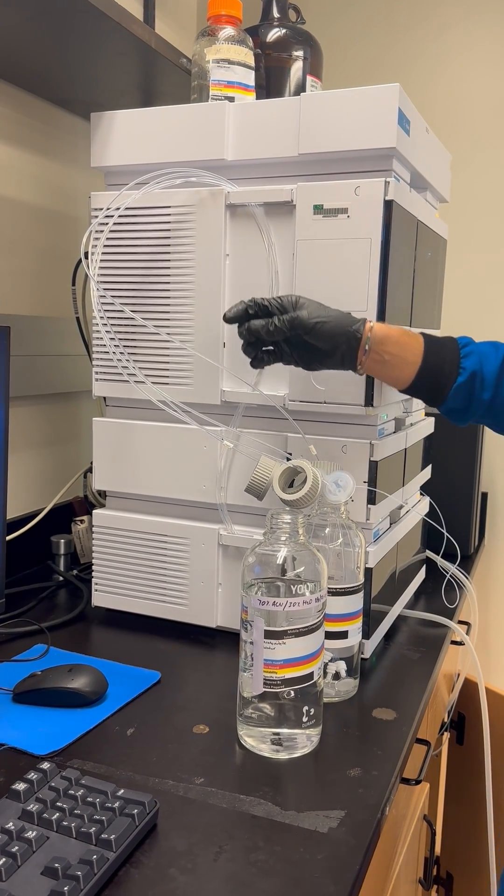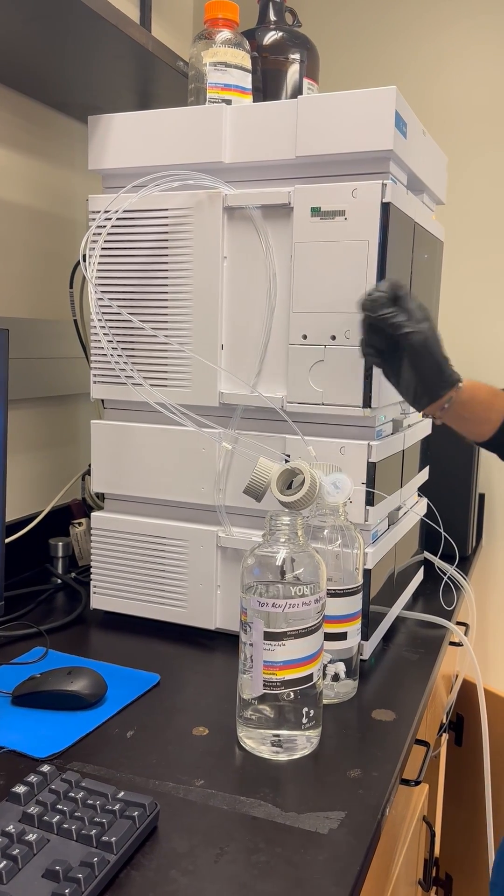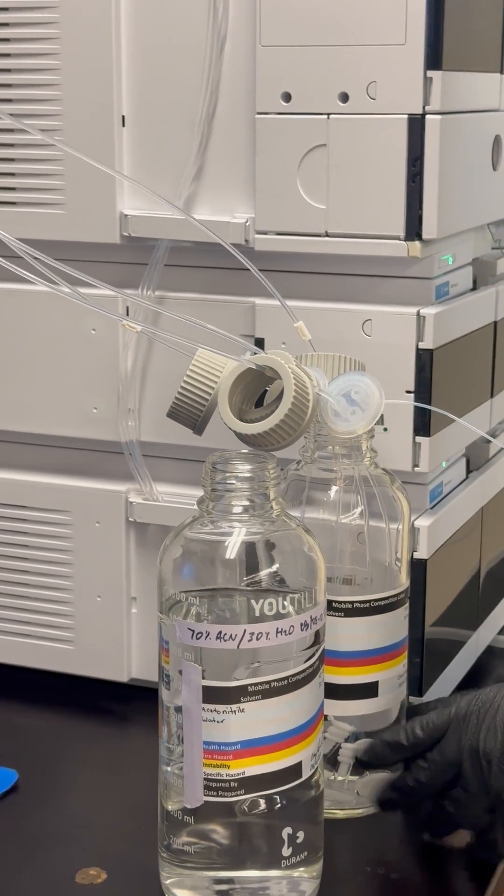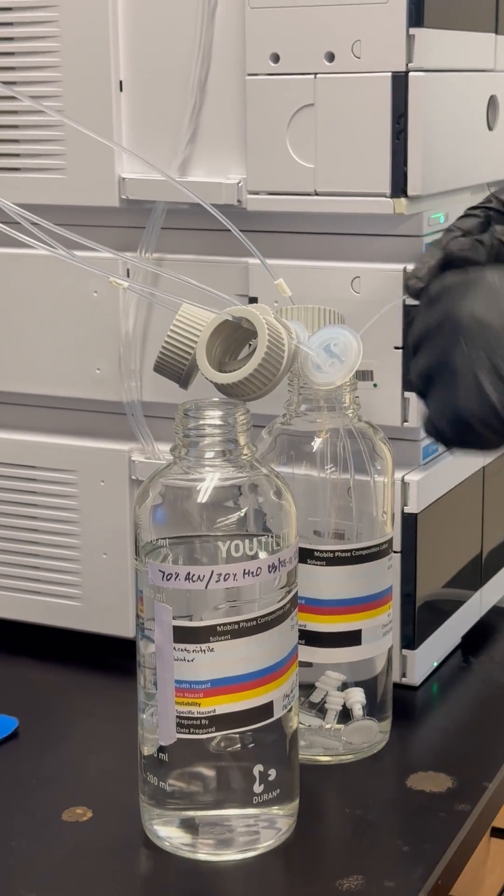There will be back pressure and there will be suction on lines B, C, and D. Assuming this might be in a totally different mobile phase, that is an issue, and you don't want that issue to hurt your analysis.